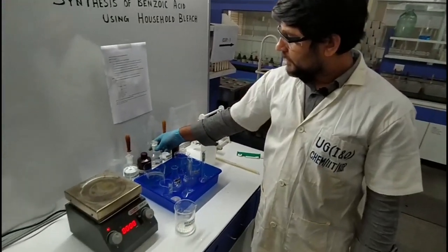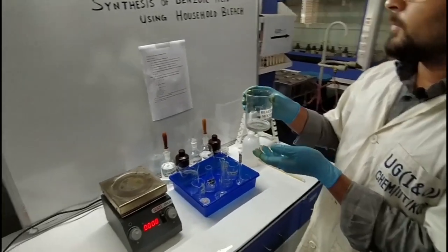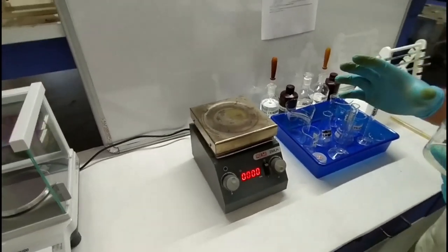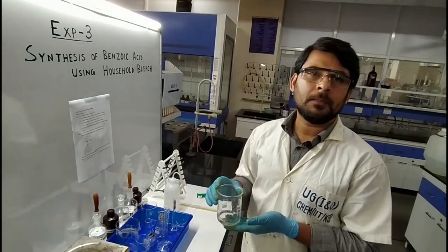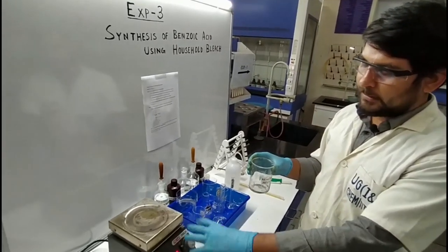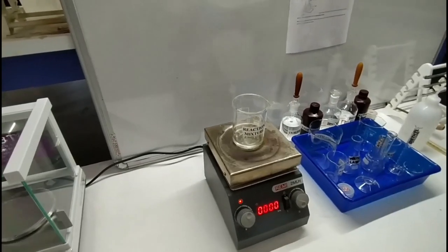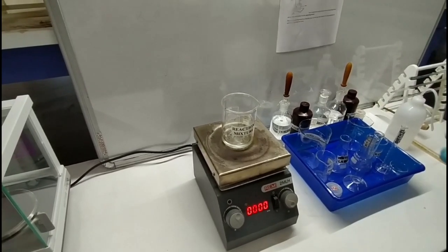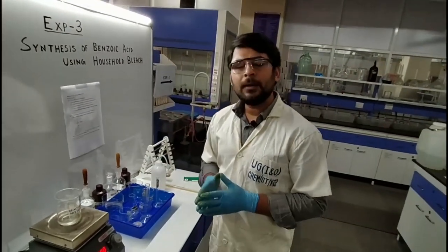Now all 3 reagents are already inside the reaction mixture container. We have to place this reaction mixture container above the hot plate and heat it to nearly 75°C — that temperature is already set on this hot plate. I am just going to put it on here. We have to wait 30 minutes to complete the reaction. Basically, this is a haloform reaction, so we are going to wait for 30 minutes.